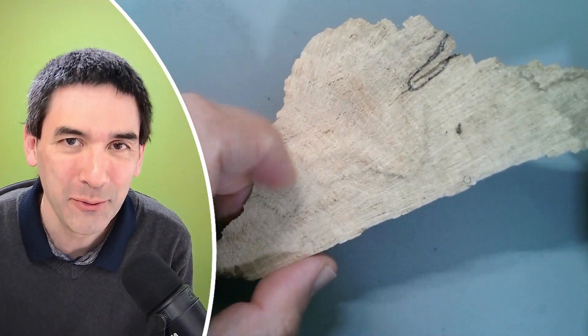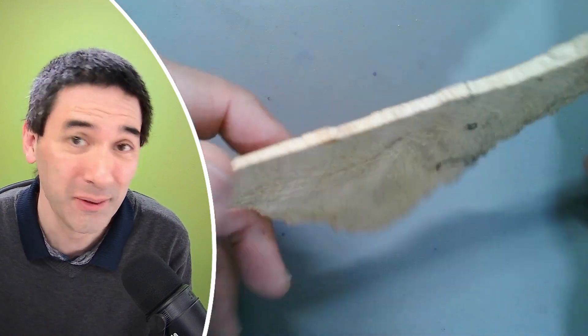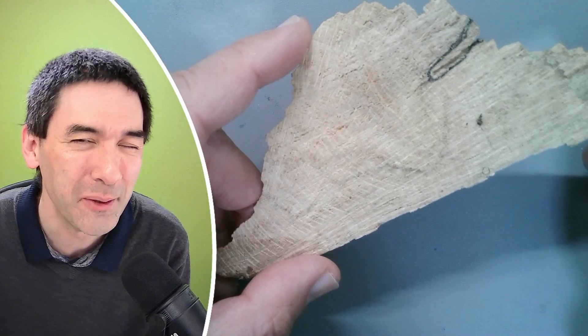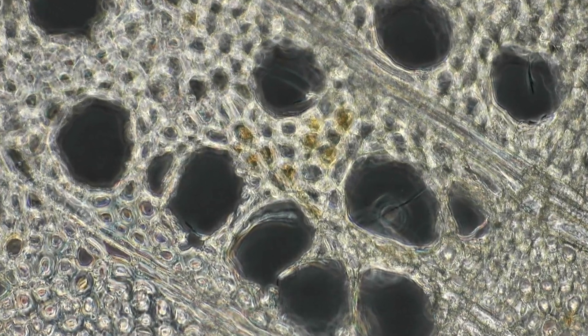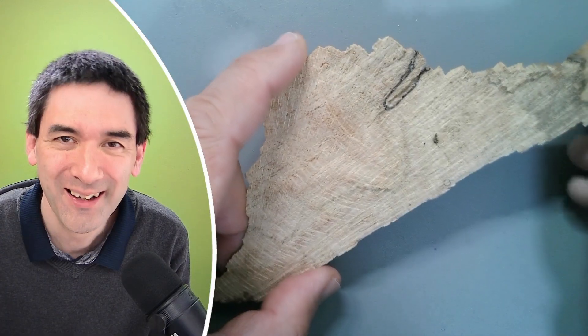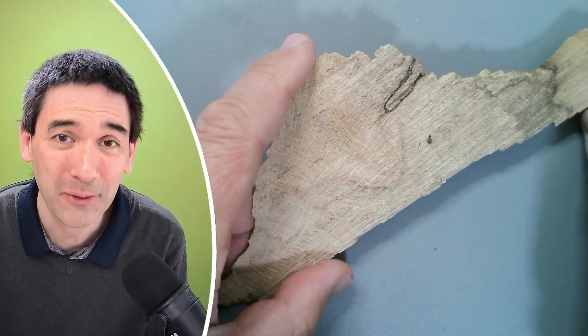Today I'm going to show you how you can put some wood under the microscope so we're able to see a few cells. We'll also be looking at the wood using different lighting techniques. So hi, hello and welcome again. Microbe Hunter here.